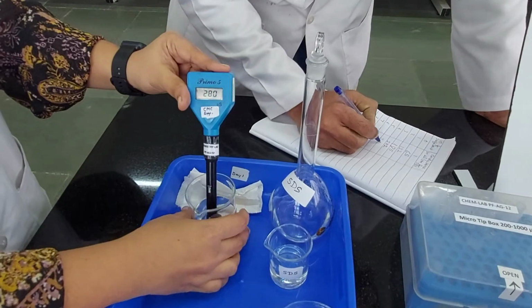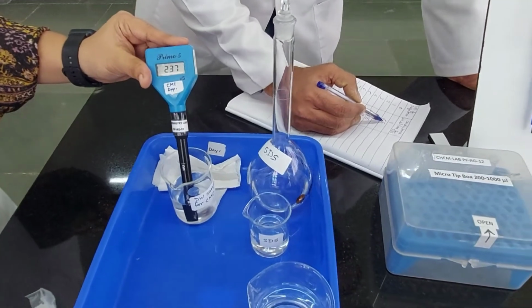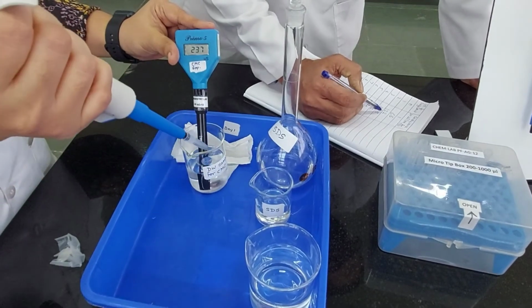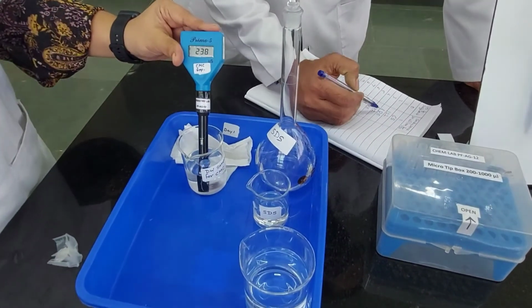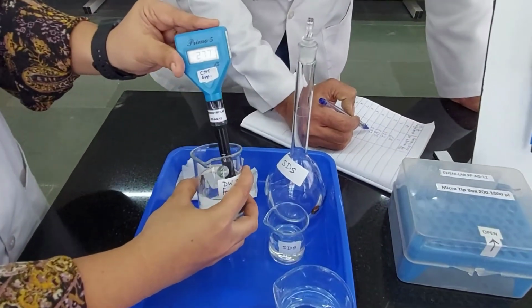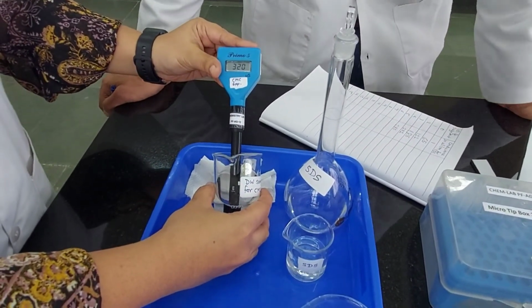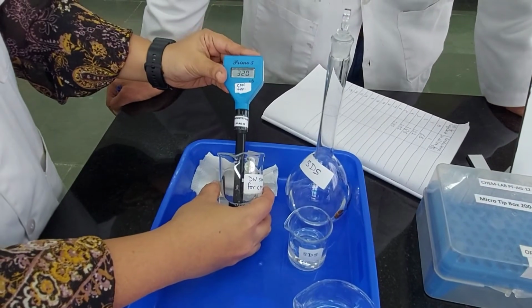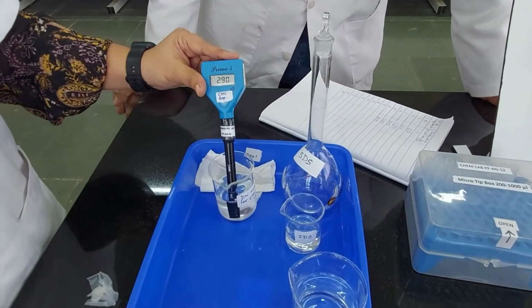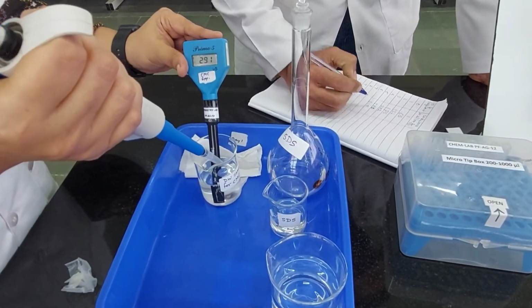280. Let's make a note of it. Now if you see from the first, it was a jump of 60 units, and now the increase has slowly slowed down the jumps, right? Now there goes the next milliliter, the 6th milliliter, and the value is 320. As you can observe, on addition of the detergent the value is still increasing, but not as steep as it was before.